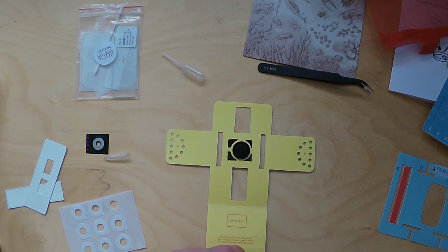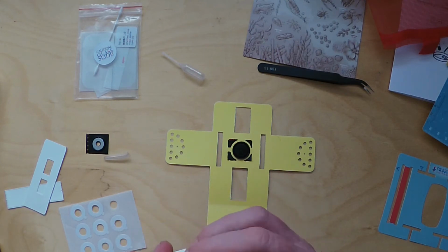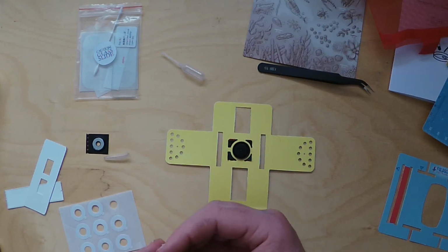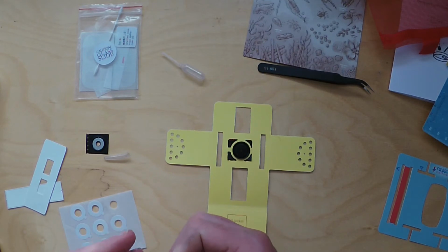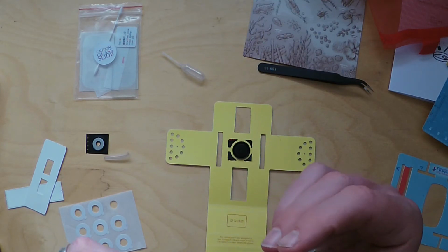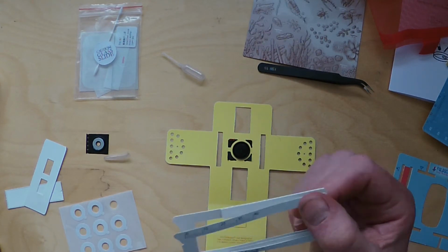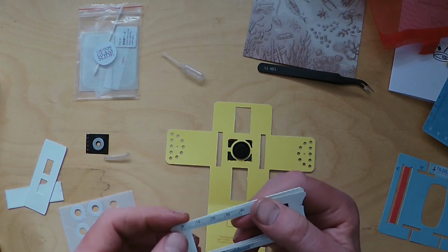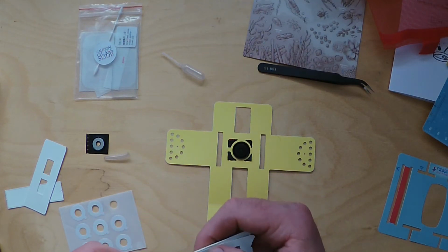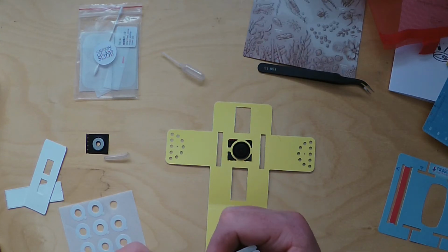Okay, so I'm folding in all those perforations now. They're folding in, and you'll sort of concertina them in until you end up with this shape. And you'll see here you've got one end is flat and then the other end has built up that extra bit of space, and basically what that does is it acts as a wedge. You can see they've kind of standardized and measured the effect of that.